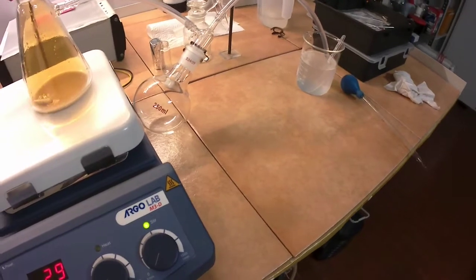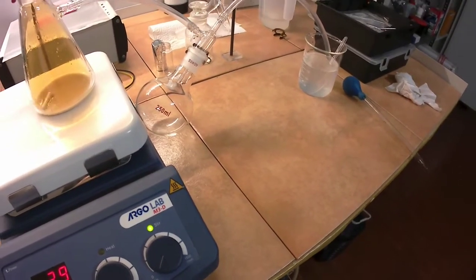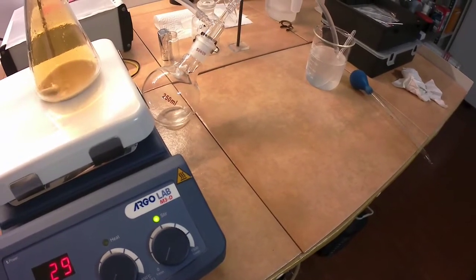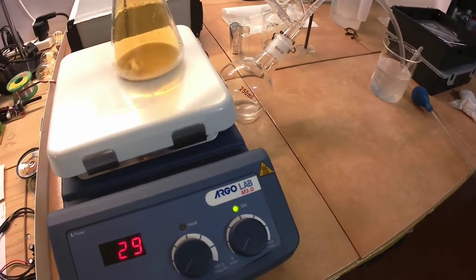Here's why you need the suck-back trap. As the reaction starts, the volume of air in the apparatus shrinks, and without the suck-back trap, the sodium hydroxide would drip into the reaction flask, ruining the reaction.